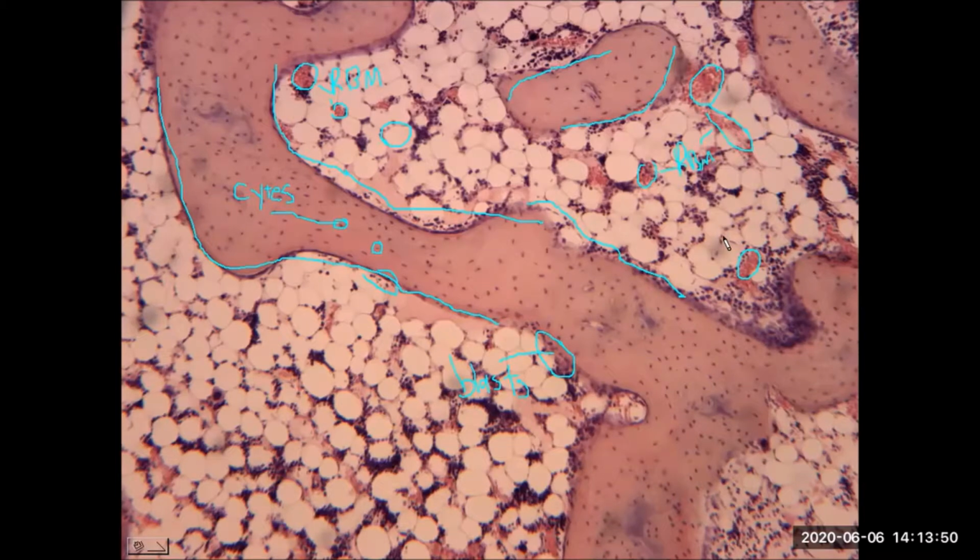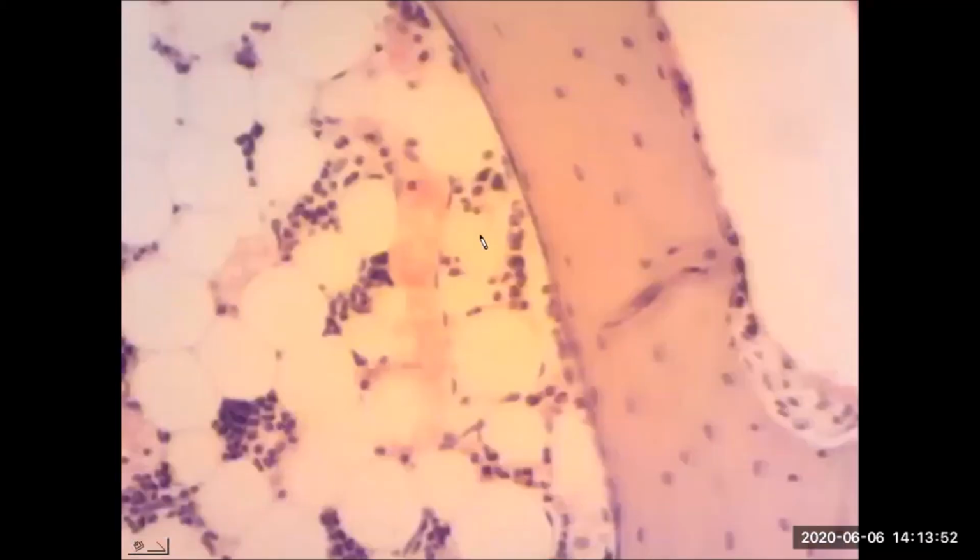And a closer look at this sample, so we're zoomed in. Again, you're seeing the red bone marrow. For reference, I just want to point out all the adipose tissue you see on this spongy bone sample. We have this pink fragment here of the trabecula and osteocytes embedded inside, and osteoblast cells right along the border of the trabecula.